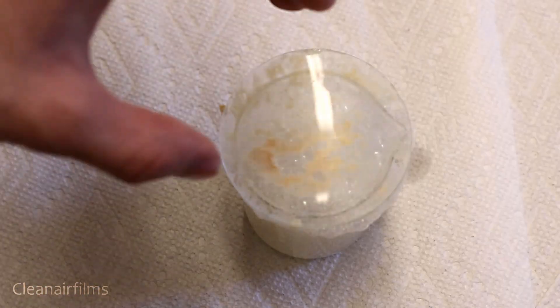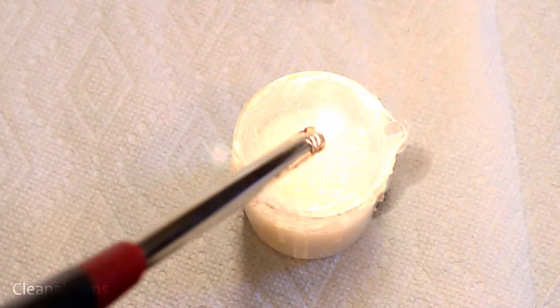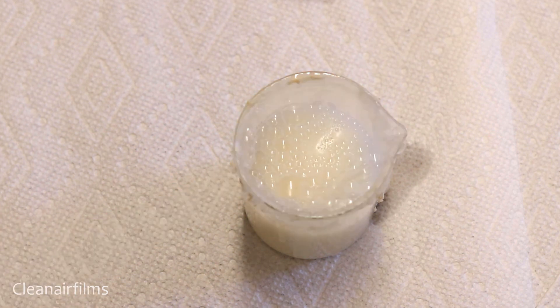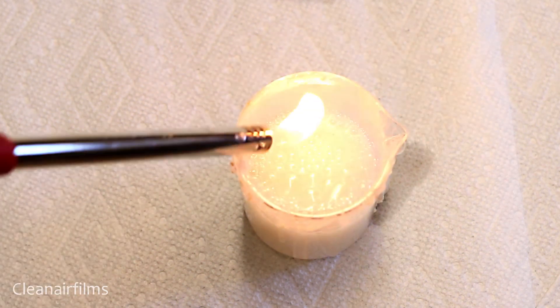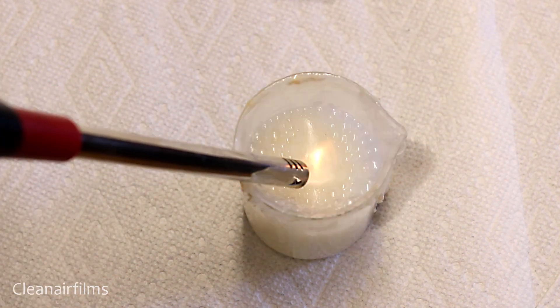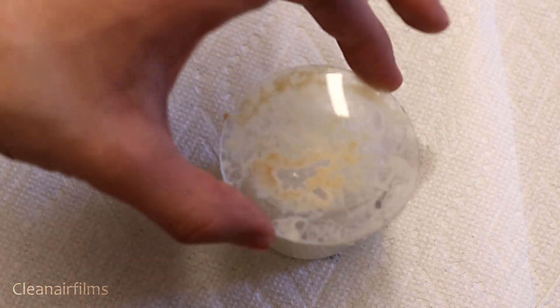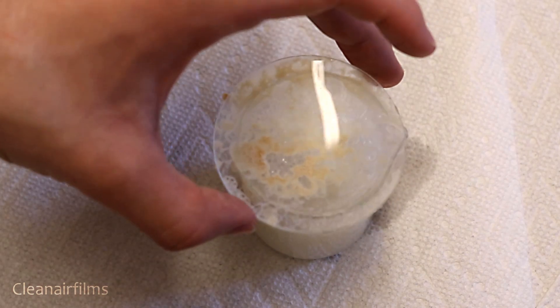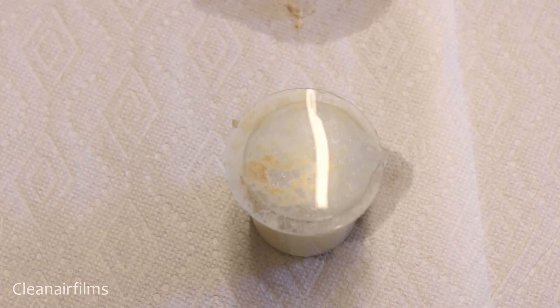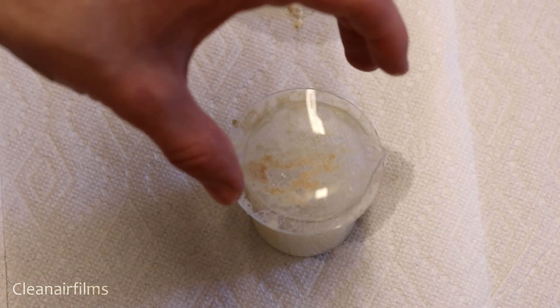Just for fun, I will use a lighter to test the flammability and confirm the identity of the gas being released. That slight pop and increase in flame brightness is the combustion of oxygen gas.